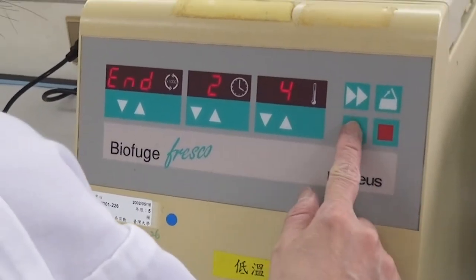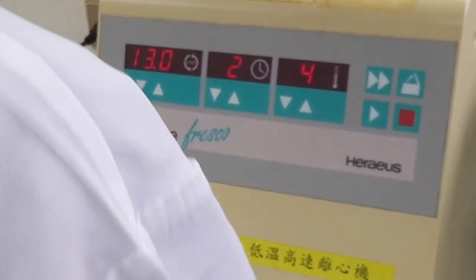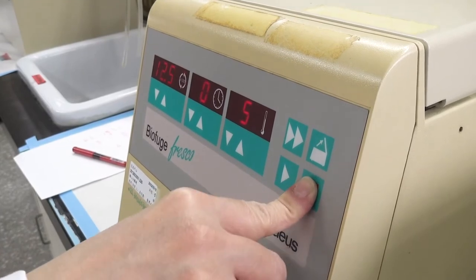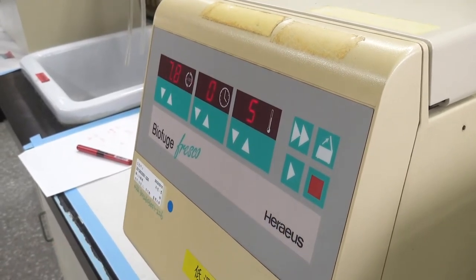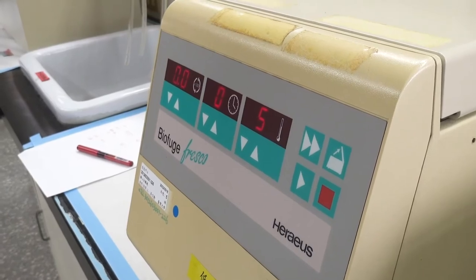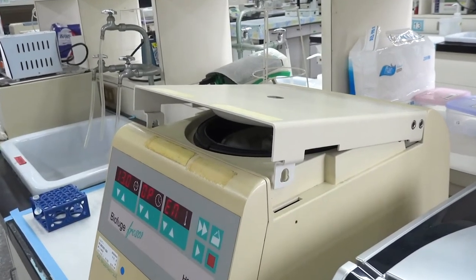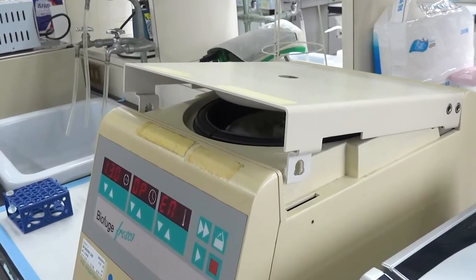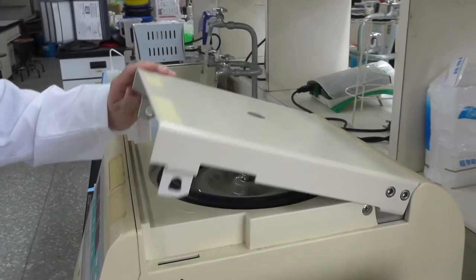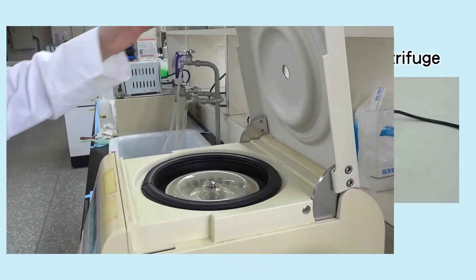For safety, please only leave the centrifuge after it is running normally. If sounds of abnormal rotation are heard or the centrifugation must be terminated halfway, press the stop button. Press the open lid button only after the rotating speed has reached zero or the panel shows the letters END, then open the centrifuge's lid to examine the condition or to take out the samples.